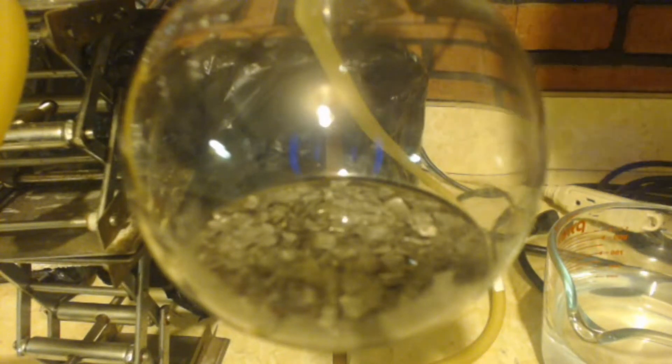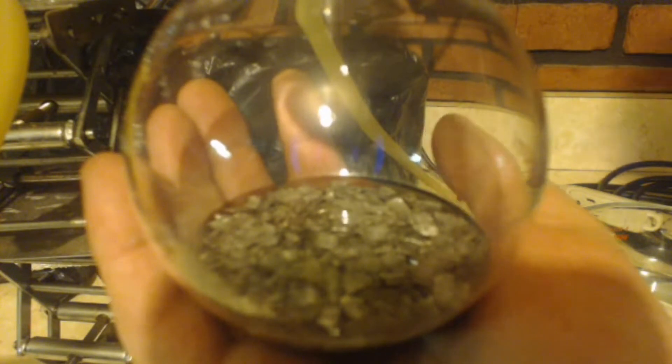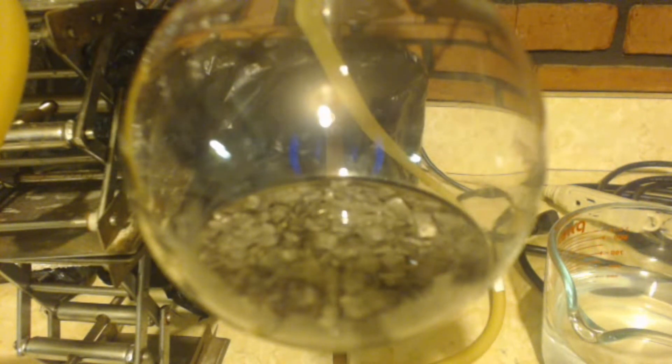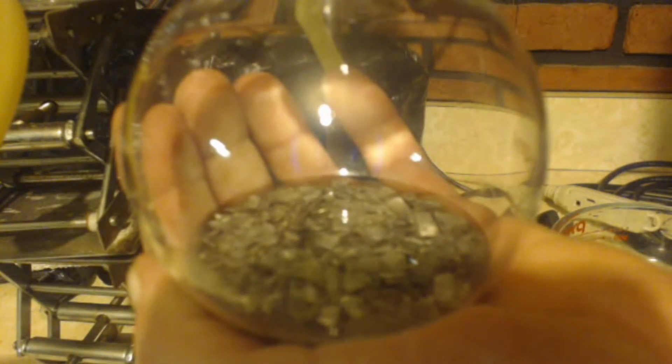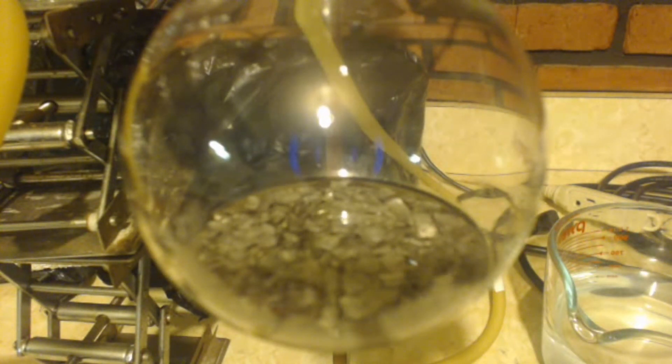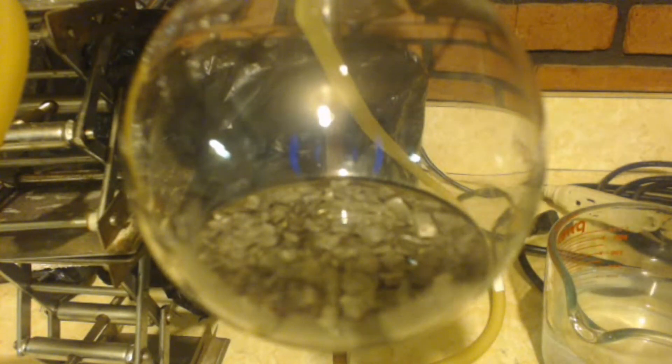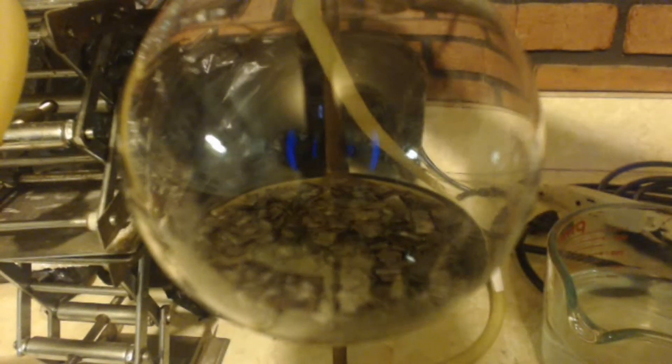It's been 30 minutes now. Keep in mind this room is 17 degrees and this has been at 36 to 43 degrees for like 32 minutes now, 30 minutes or whatever it's been. So obviously something's happening. Or it went up that many degrees by itself and stayed there for half hour now. I'll just keep adjusting the drip rate to keep the reaction going. The more I drip it the hotter it gets, the less I drip it, you know. Sometimes I'll stop it dripping, most times it's just stopping by itself, so I'm going to start it back up.